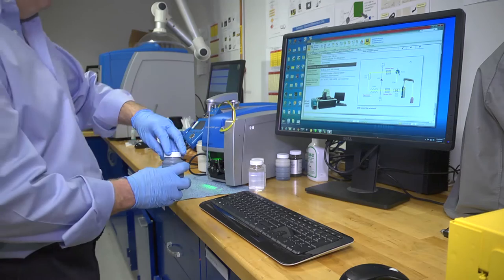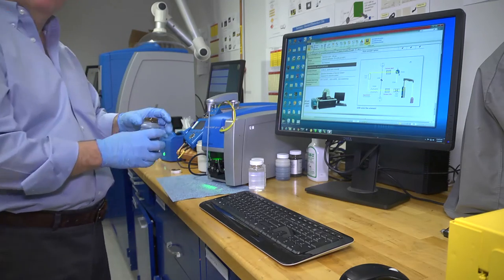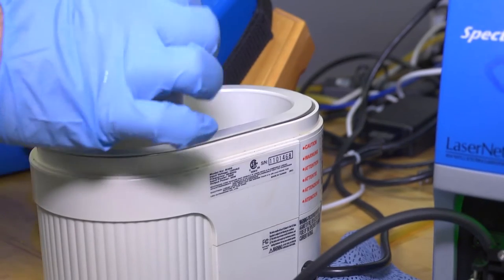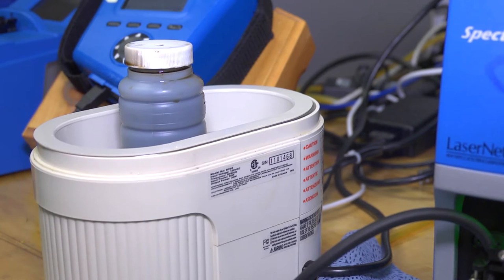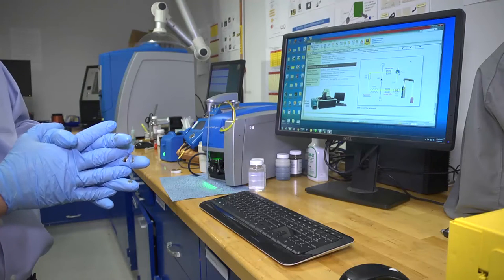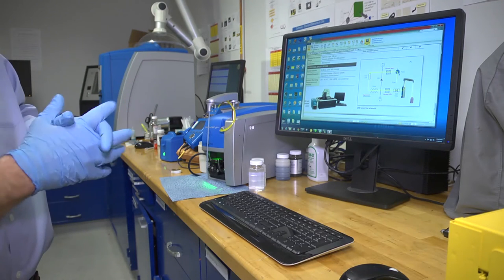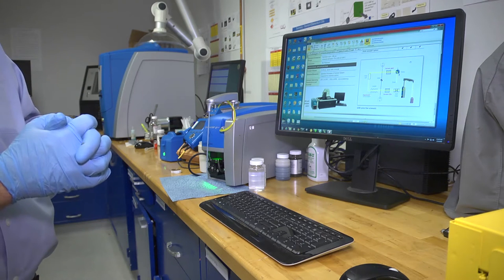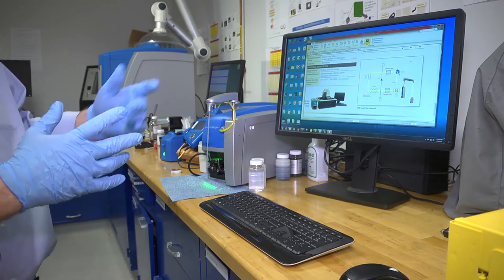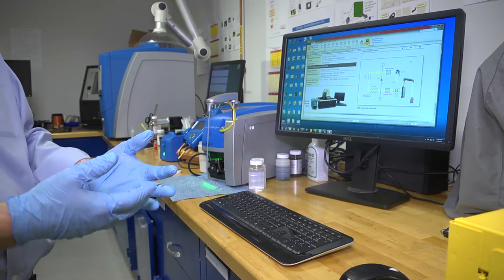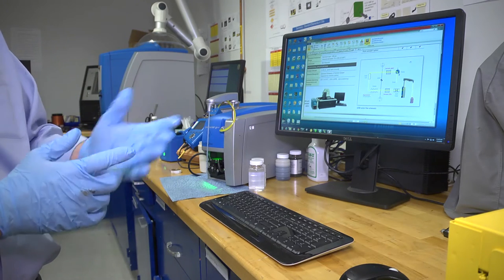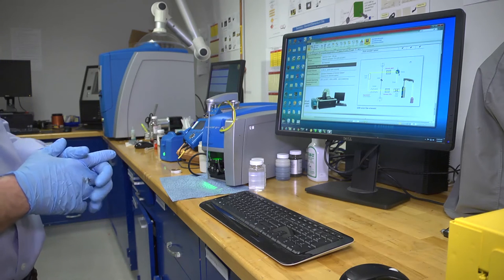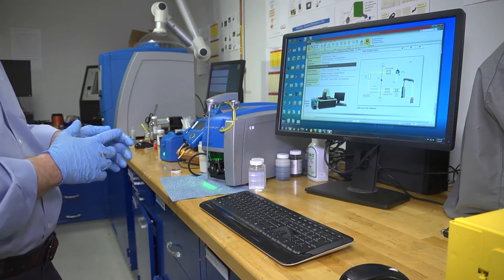Once your 30 seconds are up, because of vigorous shaking I've injected some air bubbles, it's necessary to put it into an ultrasonic bath in order to dislodge and remove the air particles. The ultrasonic is done for 30 seconds, not longer. If you let it sit too long, the particles that are now suspended from that vigorous shaking will settle out to the bottom and you won't get an accurate particle count. So once 30 seconds are up, you're ready to process.